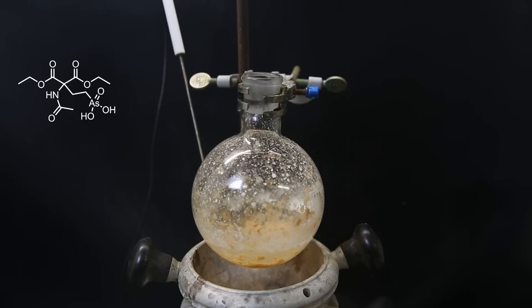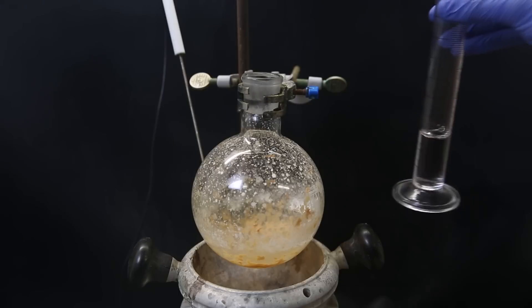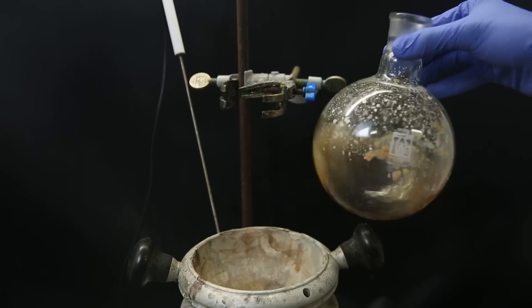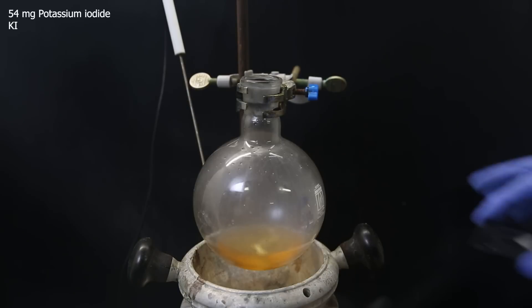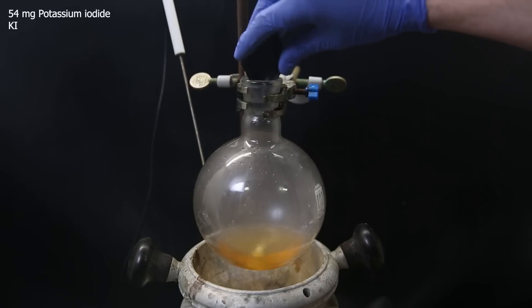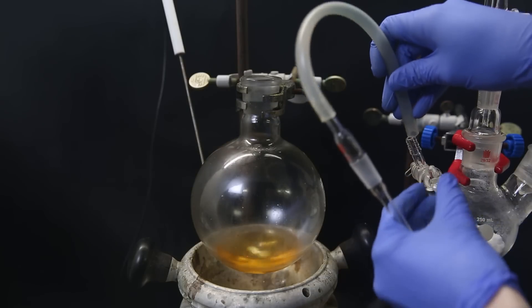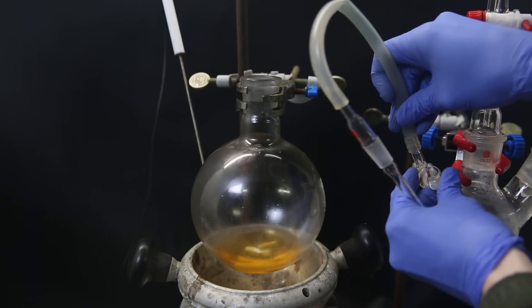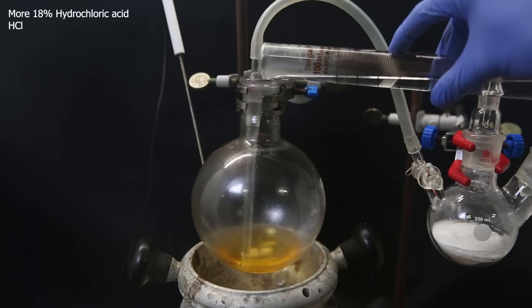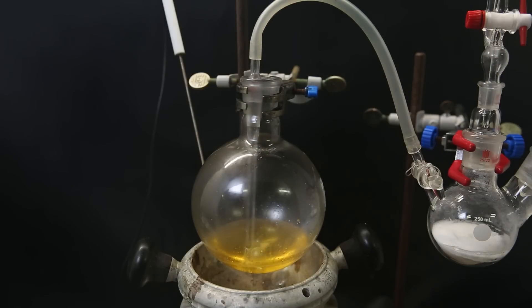If my final product contains glycine because of that, it's not really a problem to see if it is antibiotic. To continue, I dissolve all of the solid in about 30 ml of 18% hydrochloric acid, then add 54 mg of potassium iodide as a catalyst. I set up a sulfur dioxide generator by reacting sodium metabisulfite and sulfuric acid, lead the produced sulfur dioxide through a tube, and bubble it through the liquid. I also add more 18% hydrochloric acid to make sure there is enough, and let it run for 5 hours.